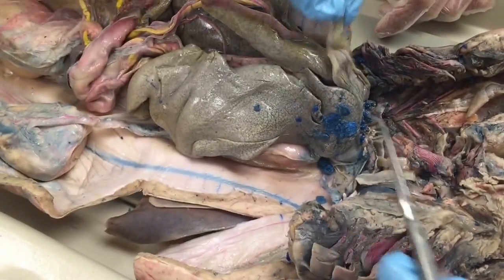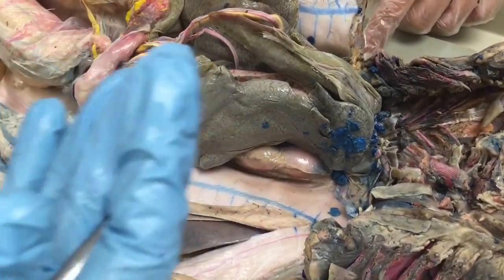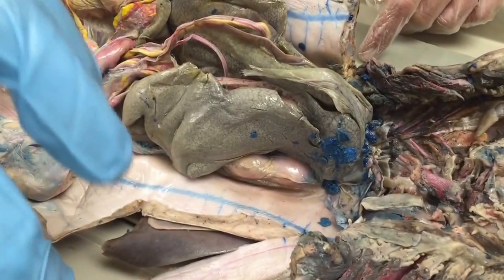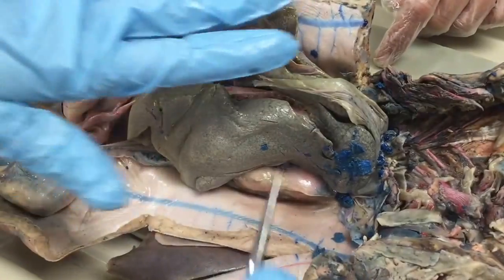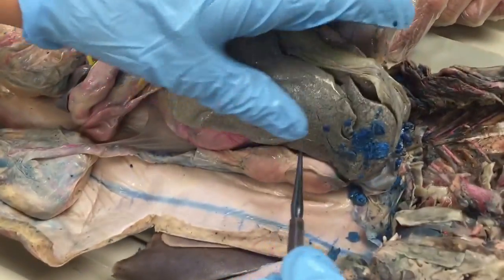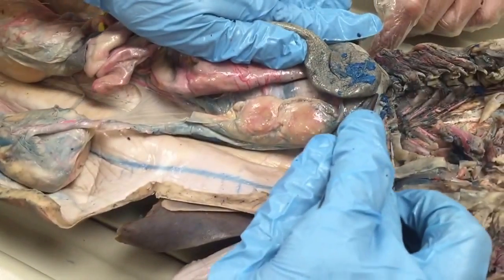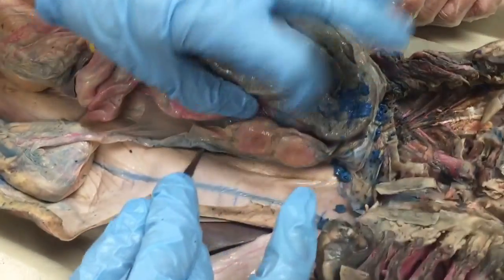It's hard to imagine how that happens, but it actually does. It's actually similar in mammals, except there's a much shorter distance to travel. There's similar tissue like the falciform ligament surrounding the ovary so that the egg is taken up into it — this is actually a very similar system. So the egg ruptures out of the ovary, goes into the ostium tube here, this opening of the falciform ligament, and passes through this oviduct here. The oviduct goes behind the ovary.